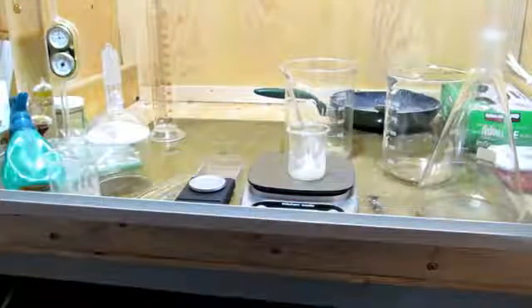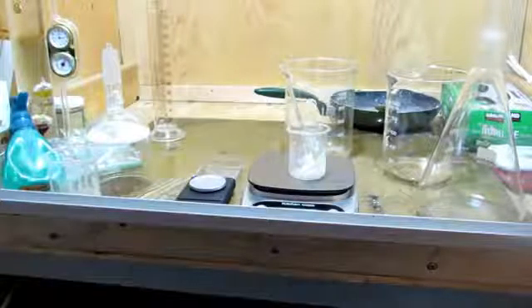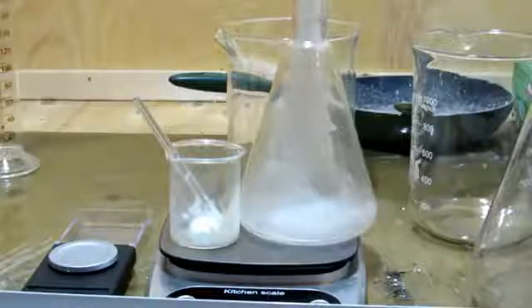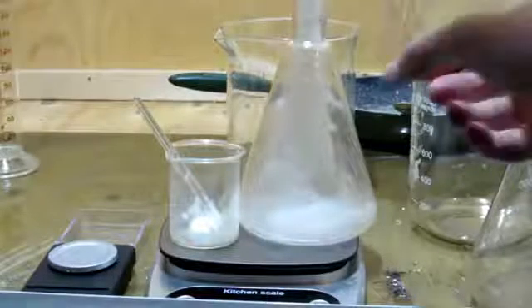Anyhow, this beaker here weighs 15 grams, however, due to water absorption, I'm more so thinking we have 11 or 12 grams of our phosphoric acid, which correlates to approximately a 24% yield. This isn't wonderful, but there was lots of losses.